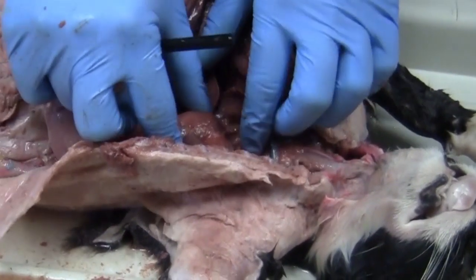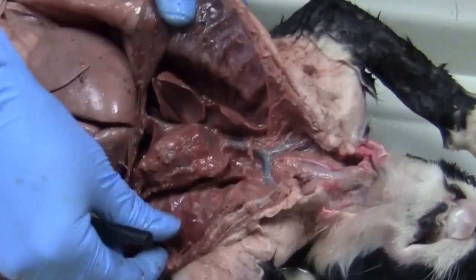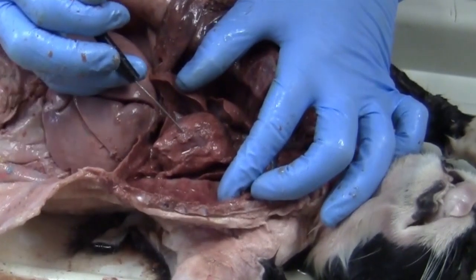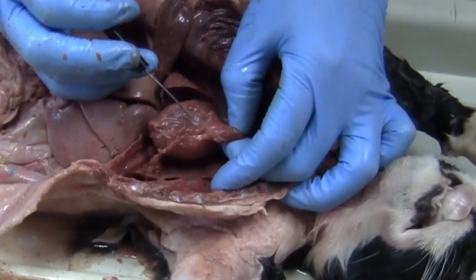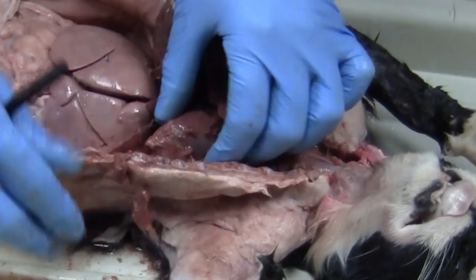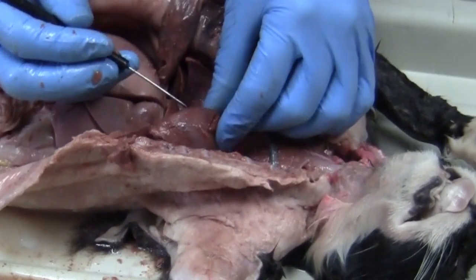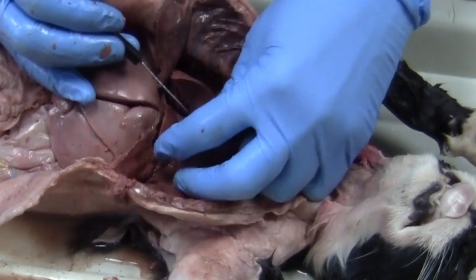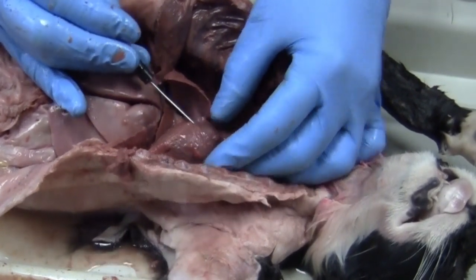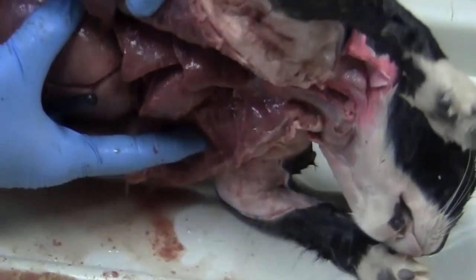And then we actually move onto our heart. So this structure right here in the middle, there's our heart. And there is a structure that goes around the heart. It's called the pericardium. Basically, there are little blood vessels and veins that go around there. And I don't know if you guys know Latin, but pericardium actually means around the heart in Latin. Okay, so you have a pericardium that goes around the heart, and you guys will be able to take that off. I'll dump some more of my fluid out a little bit.